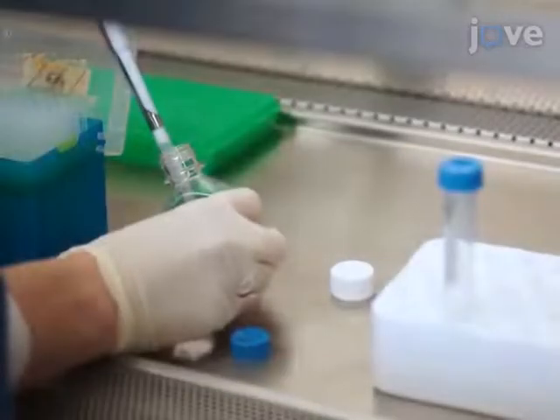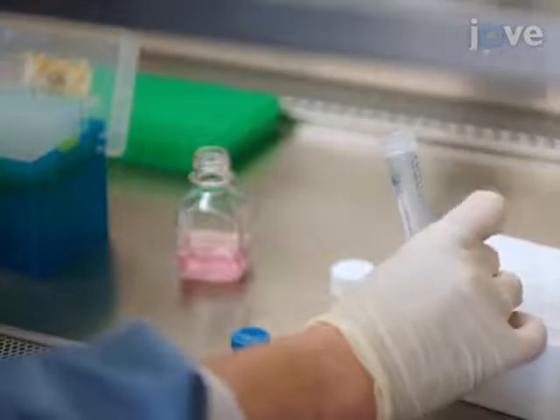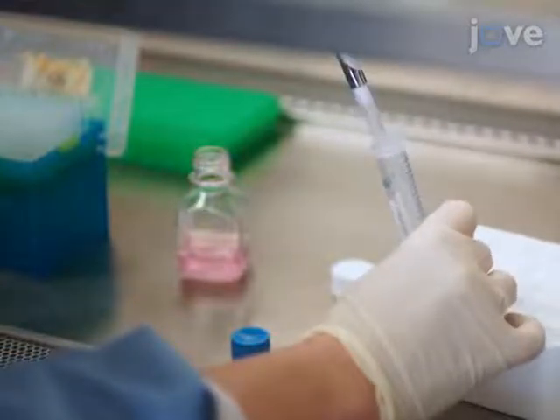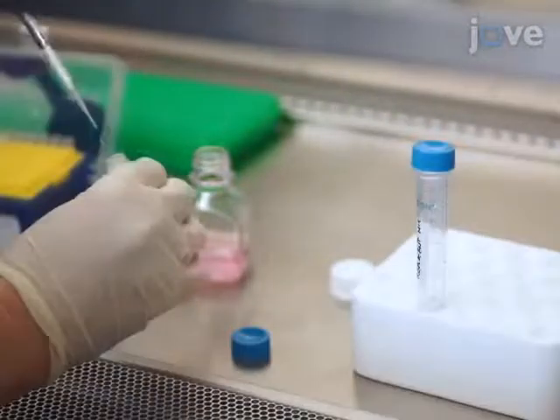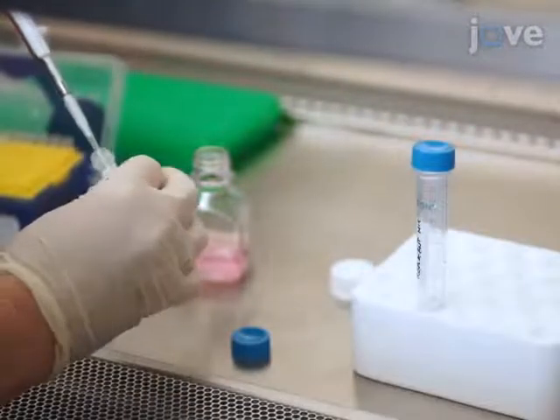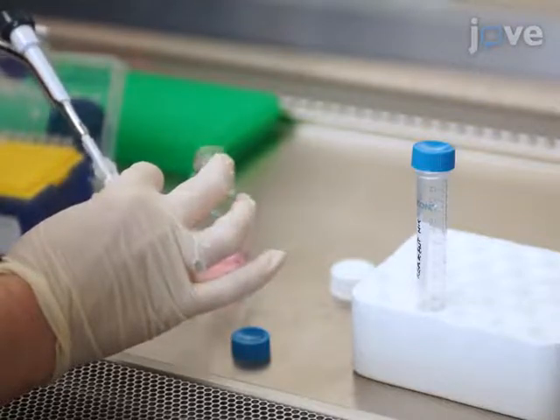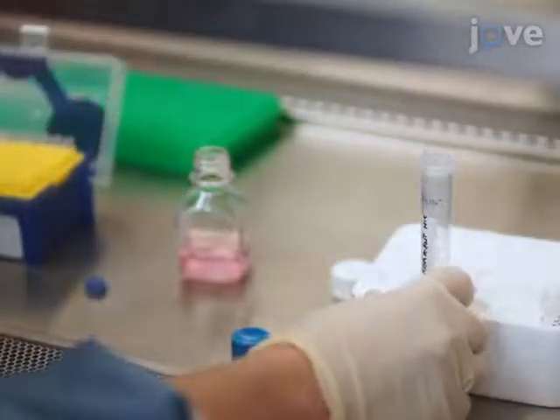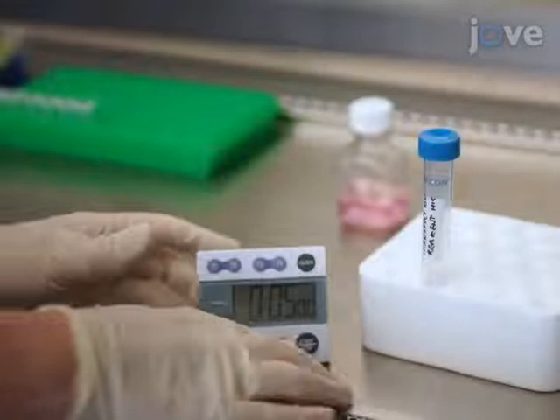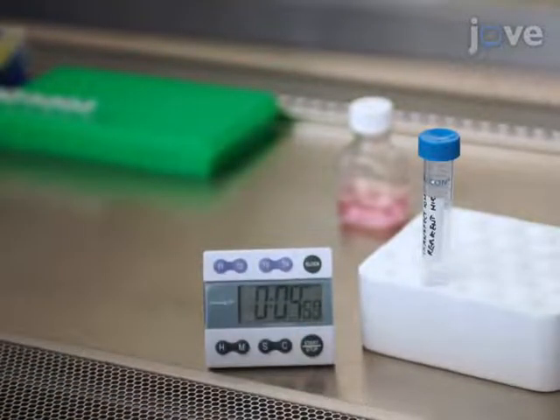To transfect the cells, first add 12 microliters of the transfection reagent to 750 microliters of reduced serum media in a sterile tube. Incubate the mixture at room temperature for five minutes.